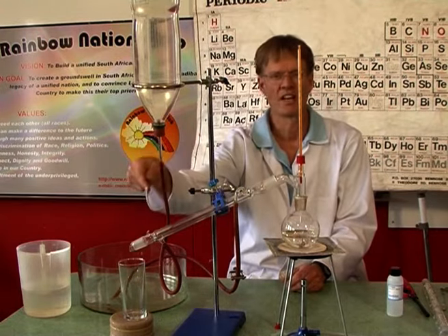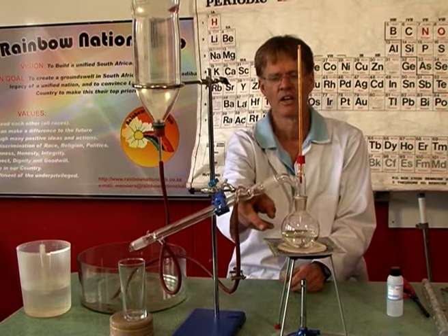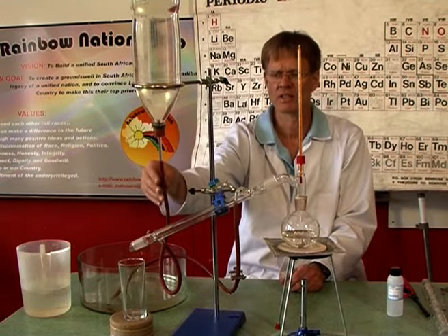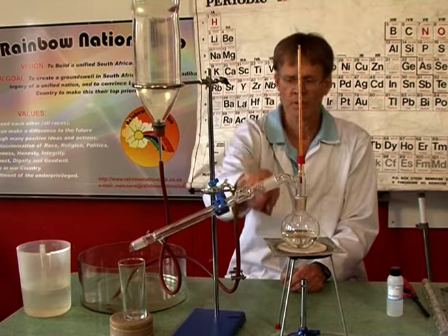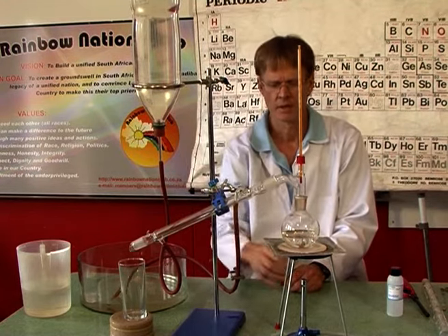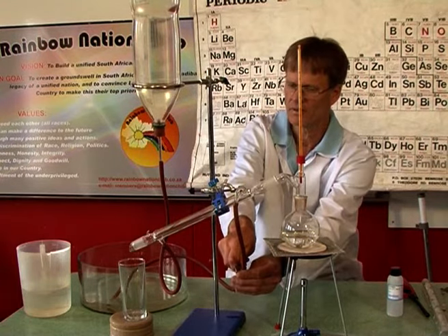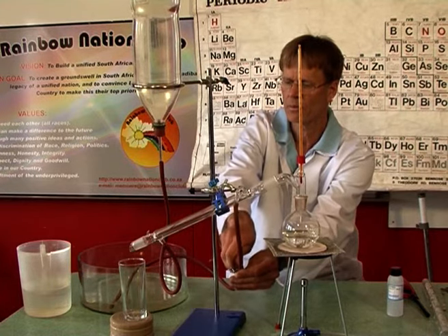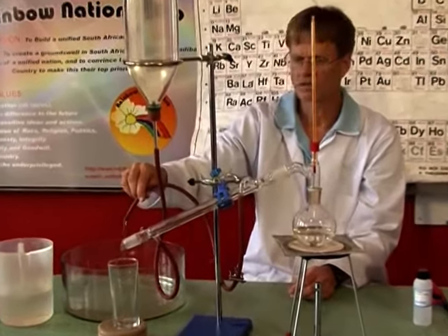through the Liebig condenser. Now this is a tube that has two layers. On the outer layer, we've got some cold water running. Now ordinarily this would be attached to a tap, and the water would run in here, through the top and out that side. So I've set up a makeshift reservoir of water, and if I open this little tap, this little clamp, there you can see some of the bubbles running through, and the water is running like that.